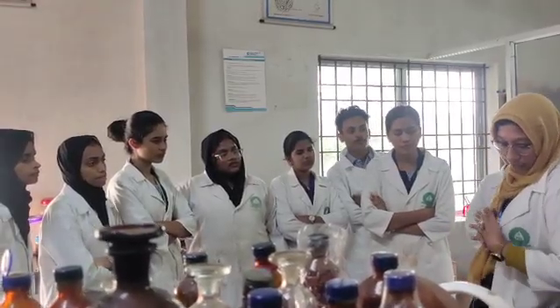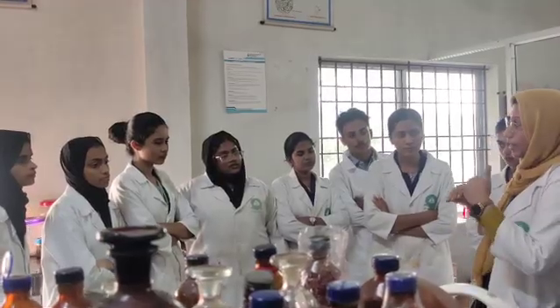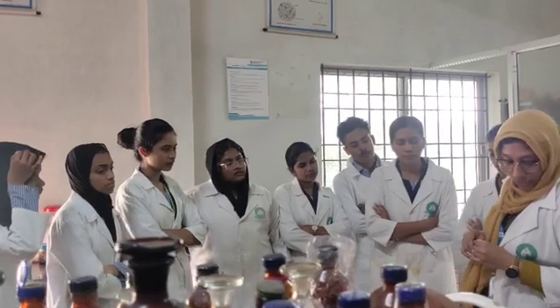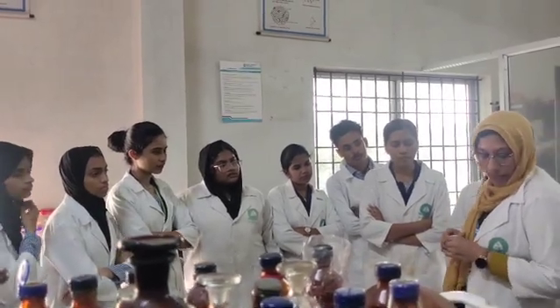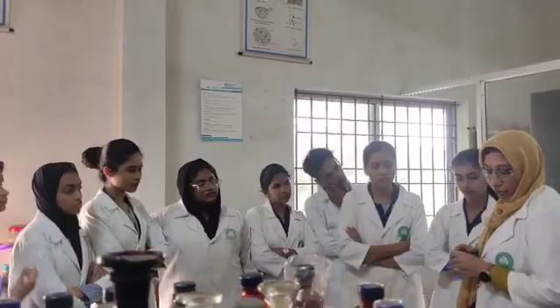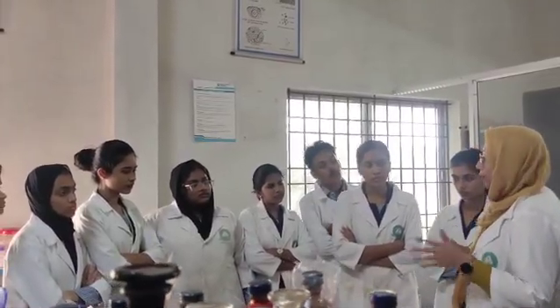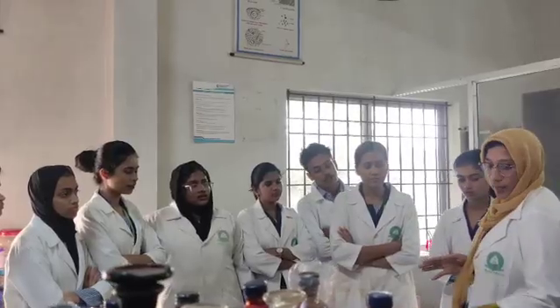The liquid is clear. What will happen? A clear, distinct solution will be formed. That will identify the presence of castor oil. And about 15 ml of light petroleum ether, when mixed with 10 ml of castor oil at 15.5 degrees Celsius, a turbid mixture is formed. That also confirms the presence of castor oil.